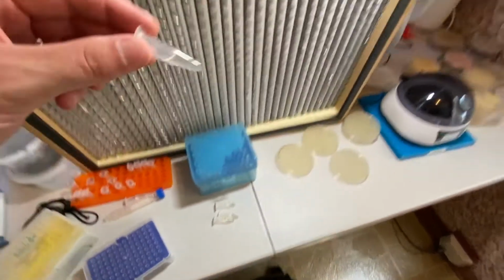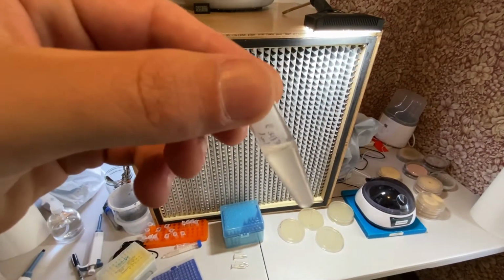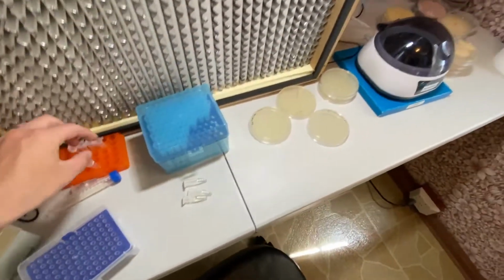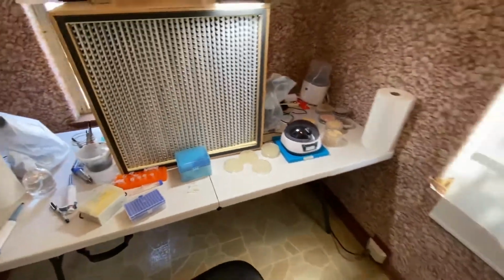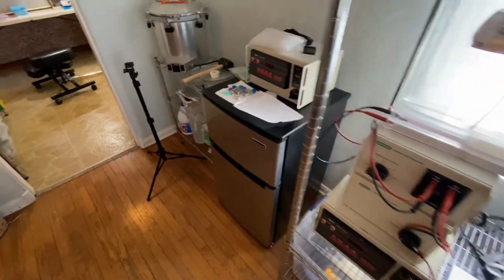That was the number 4 here, and you can see how cloudy this is after a day. So this one actually had some transformants in it, and that's probably why when I plated it, there was at least one on there. So taking all that into account, we have a couple of things that we can work on and try to work on improving.